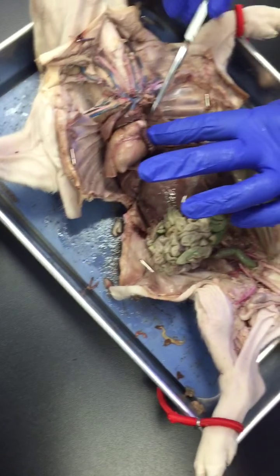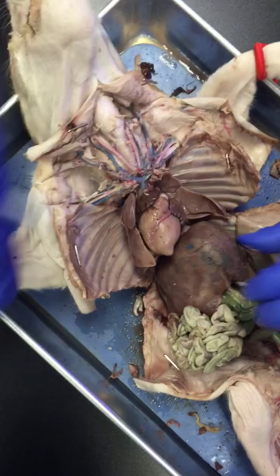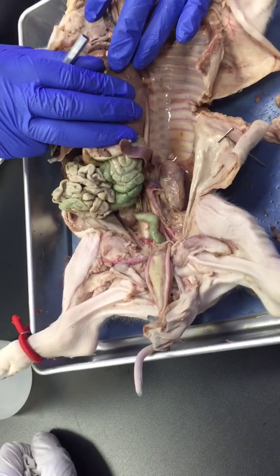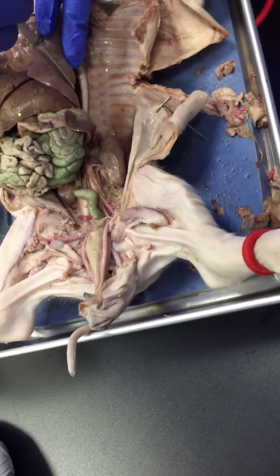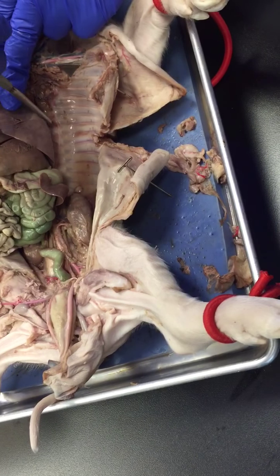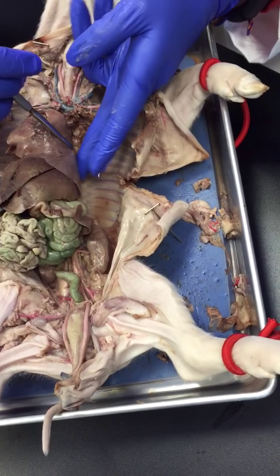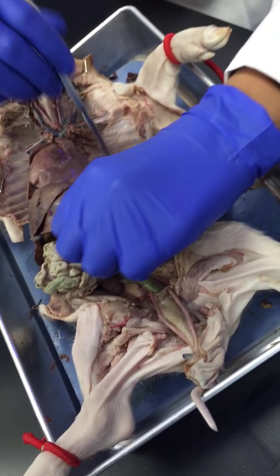So we're gonna come down here and you're gonna go back. If you follow this backwards, you will see this big tube. That is the dorsal aorta. Okay, so the dorsal aorta, and if you follow it, you see this one big blue vein right here, right? This is called the azygous vein, which is bringing back blood from the ribs, okay? Azygous vein.